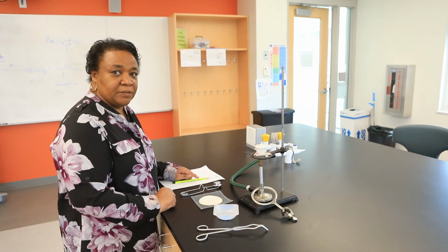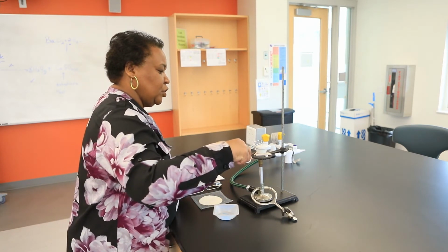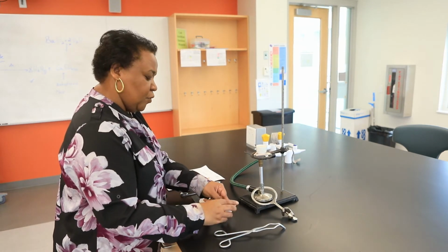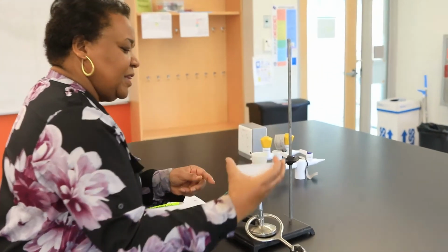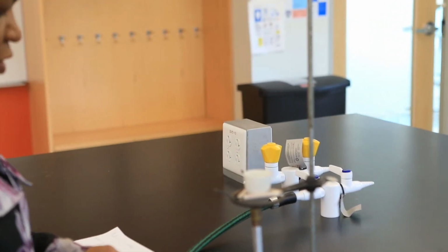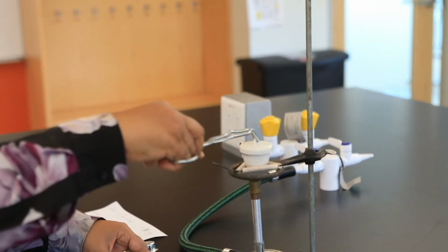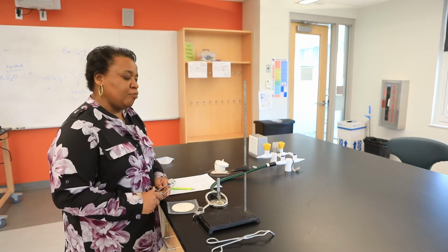43.314 grams. To the crucible, please note, we're going to be adding our hydrate. And then I'm going to record the mass of the crucible, the lid, and our hydrate. So in our next step, we're going to begin the heating process.